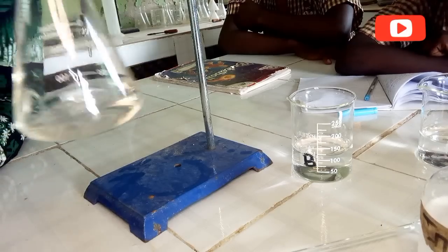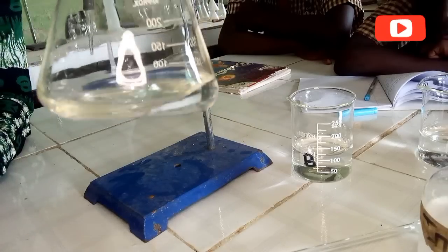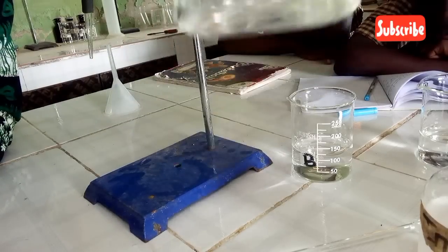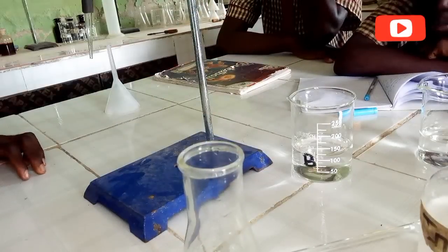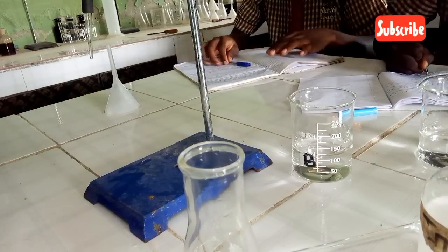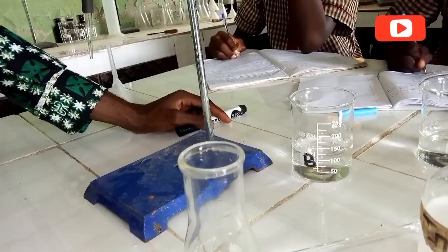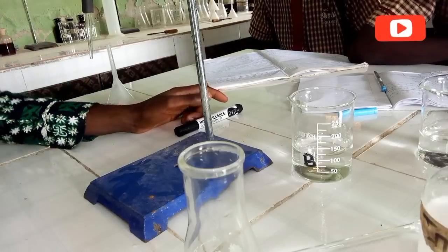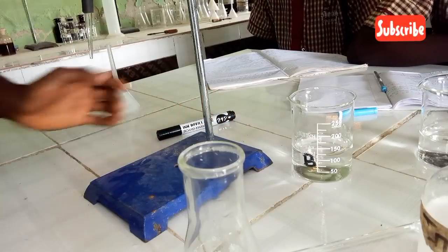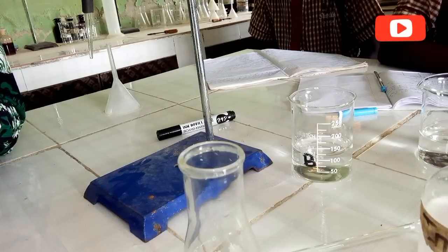The color has changed to colorless - no more pink. Let's use white light so we can see the colorless solution clearly. The endpoint is 9.0, so the final volume used is 9.0 cm³. For the second titration, I don't need to refill the burette back to zero - I can start from 9.0 to get the second value. Since the first value is 9.0, I can fit three more titrations in the remaining solution, even four if needed.